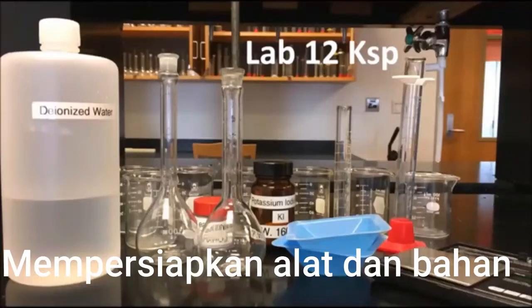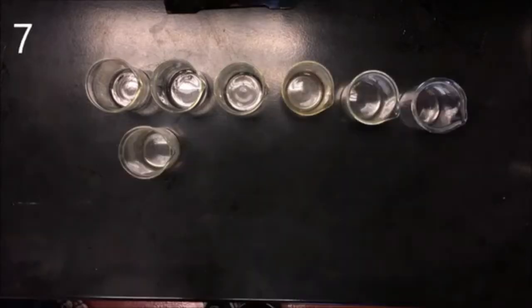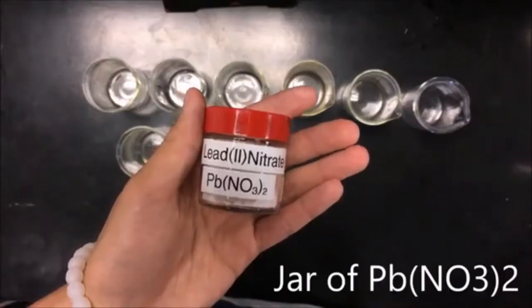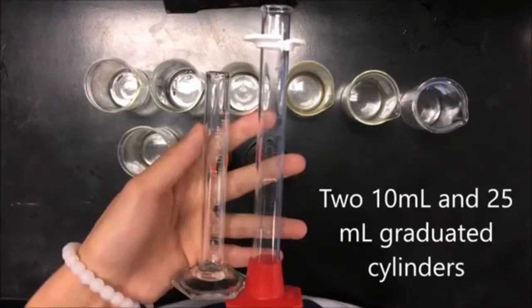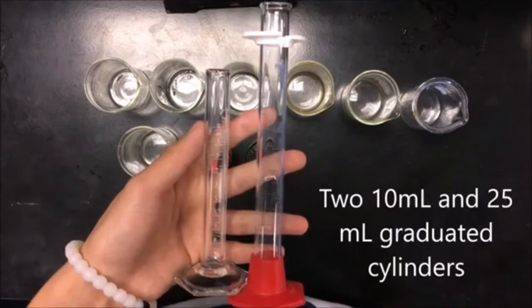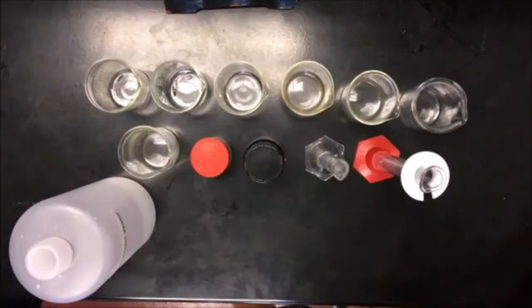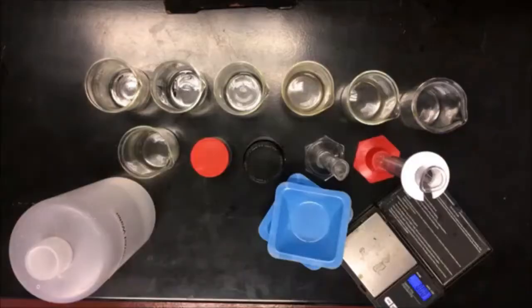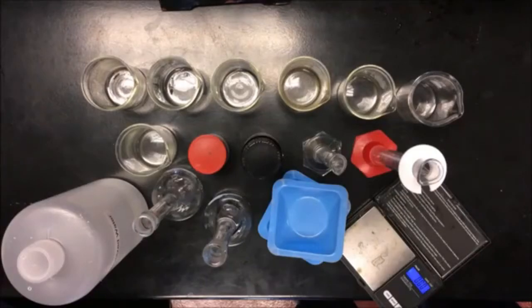Lab 12: KSP determination. For this lab, you will need 7 100 milliliter beakers, a jar of lead 2 nitrate, a jar of potassium iodide, 2 10 milliliter and 25 milliliter graduated cylinders, deionized water, a weighing scale, and 2 100 milliliter volumetric flasks.